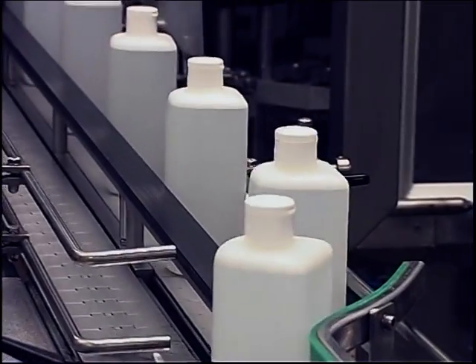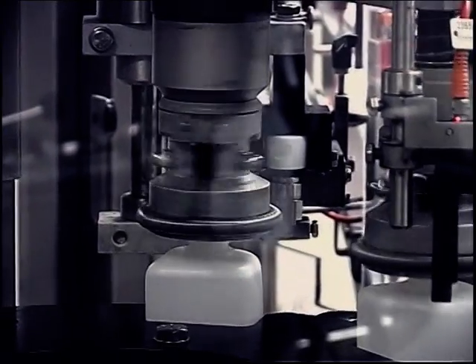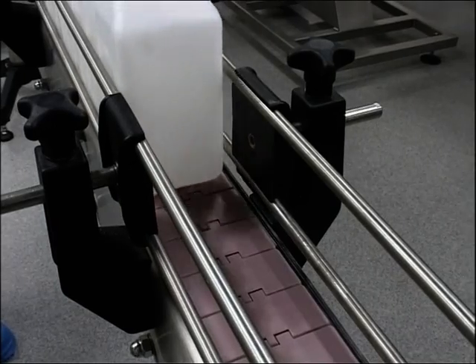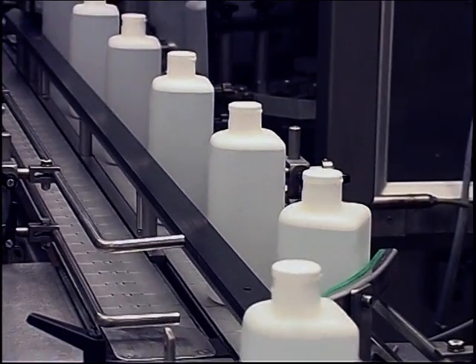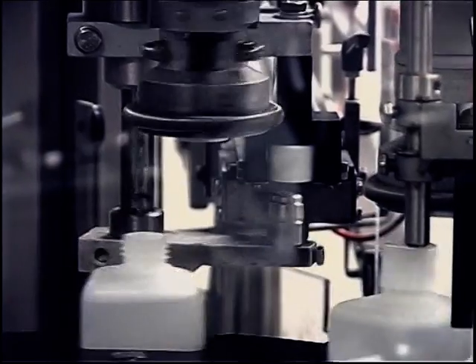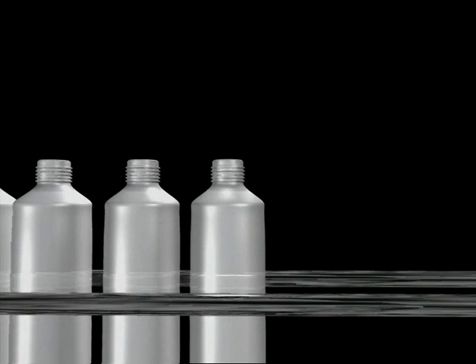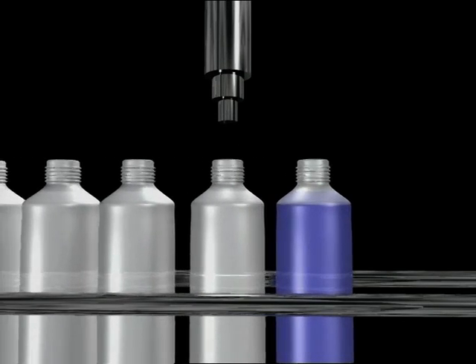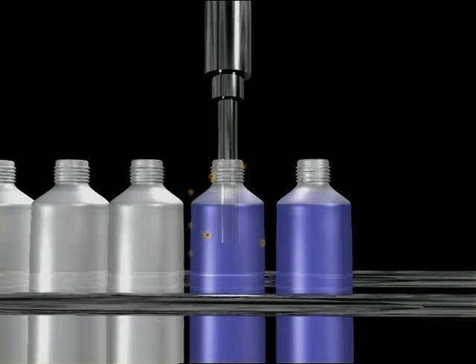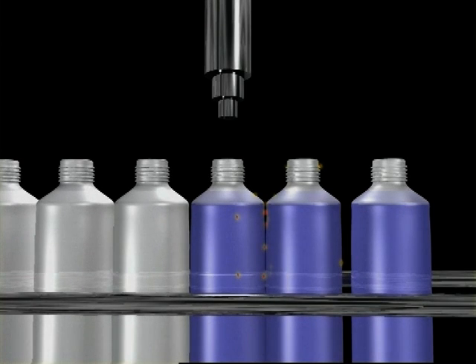All products that find their way into the human organism, i.e. as medicines or as food, must be manufactured in such a way that they are free of unwanted particles to avoid risking the consumer's well-being. All production processes harbor the danger of the transmission of particles and microorganisms to the product by the people involved in the operation or via surfaces and machines. Experts speak here of contamination. That is to say, the microorganisms and particles are passed on passively.